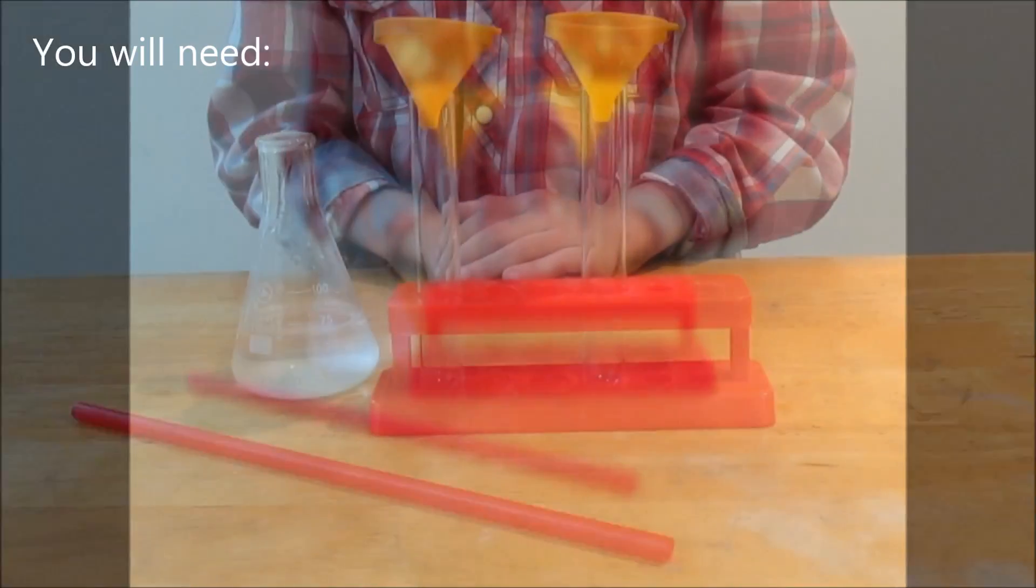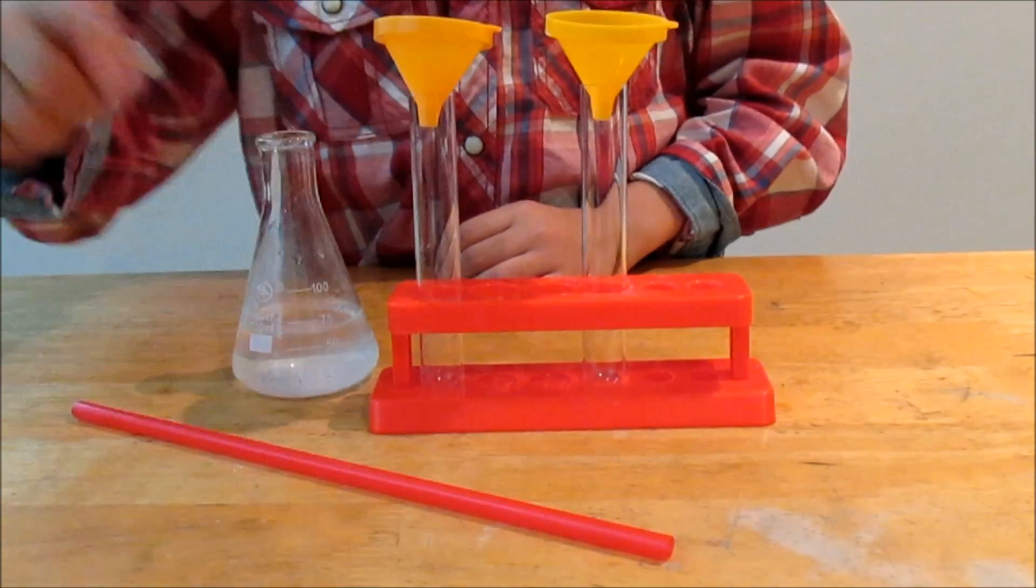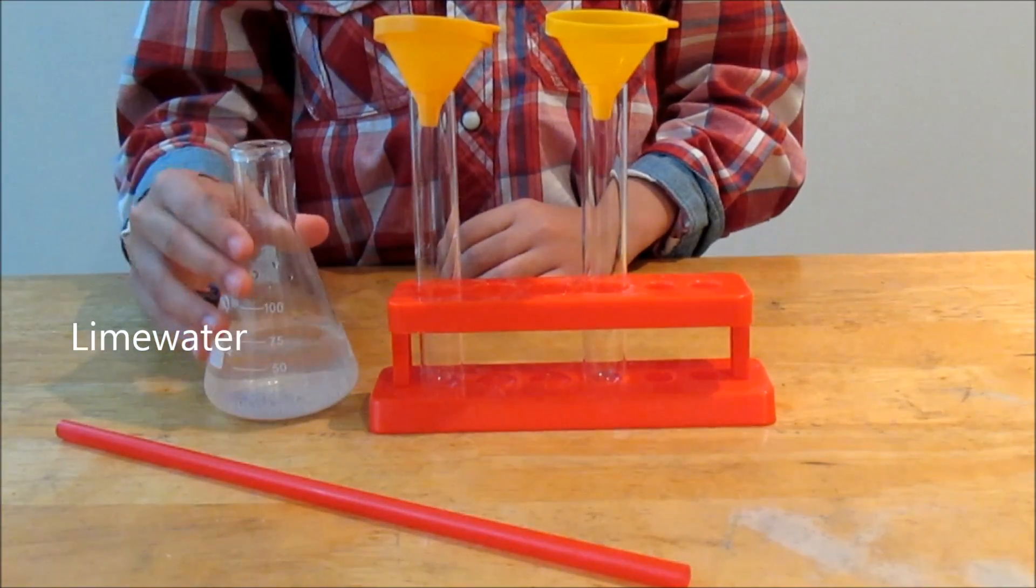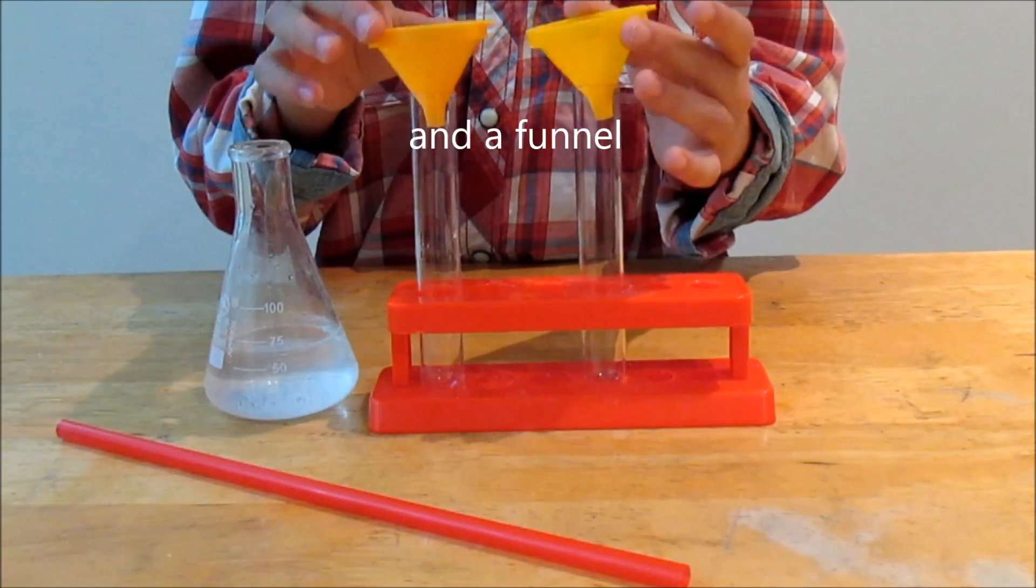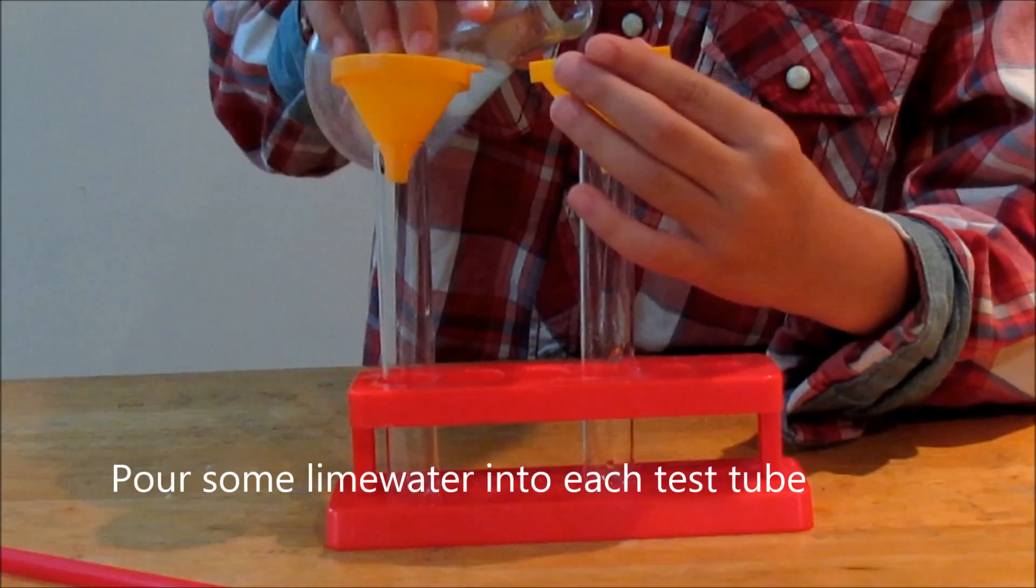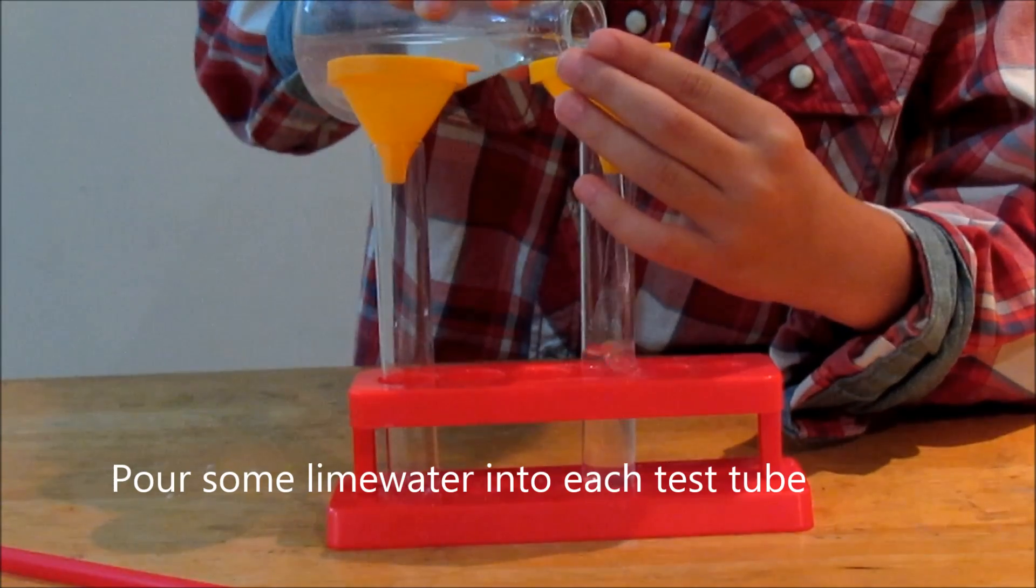You'll need a straw, lime water, two test tubes, and a funnel. Pour some lime water into each test tube.